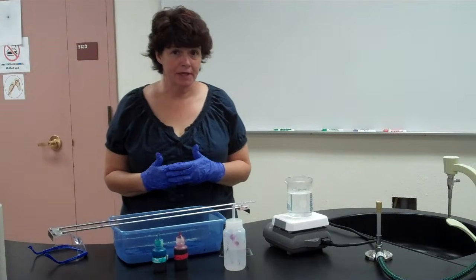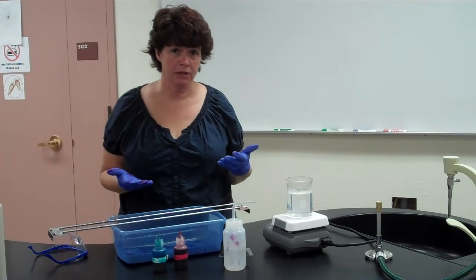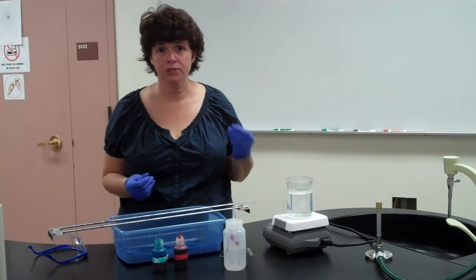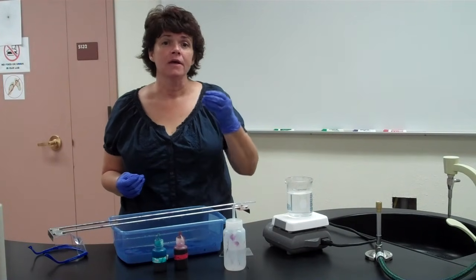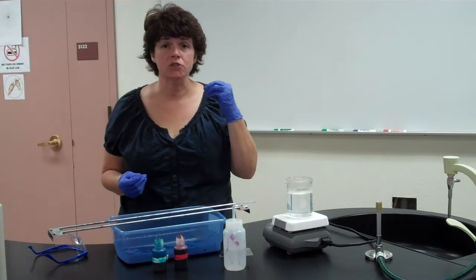The bacteria itself is going to be a large bacteria, and the endospore is going to form within the bacteria. The endospore is very, very, very resistant to environmental factors. It is basically made up of the DNA of the cell, wrapped in layers of membrane and wall, and it's extremely thick.